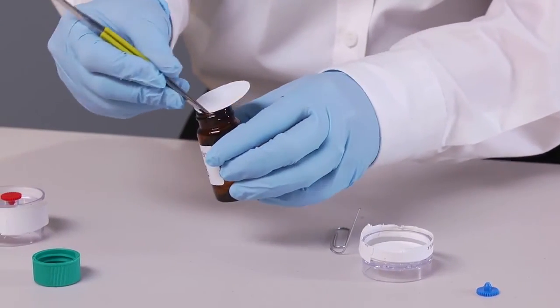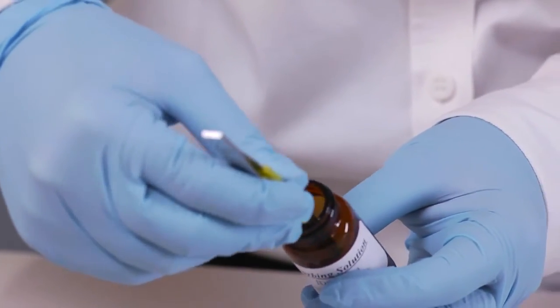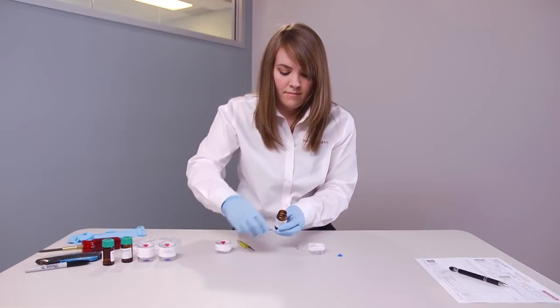Tuck the filter into the desorption vial, laying it flat against the side. Close the vial and tighten the cap.